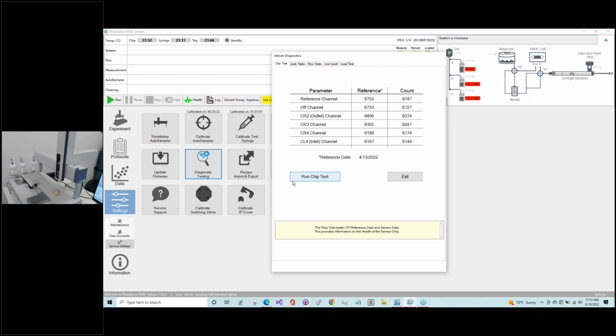If you see a count that is significantly reduced from the reference values, if it's off by maybe 100 out of the 9,000 or so, that's not significant. But if it drops to 6,000, something on that order, then that's a sign that you're going to have some trouble. And that will be verified in the upcoming diagnostic tests on the tabs that we're going to go over next.